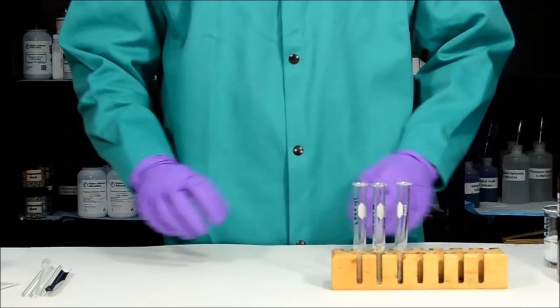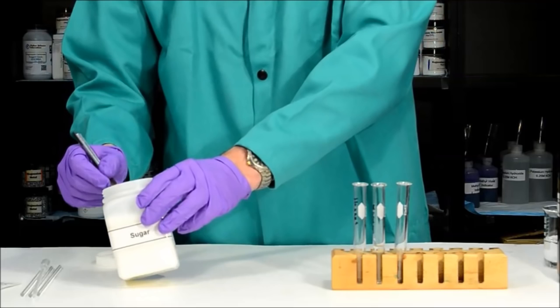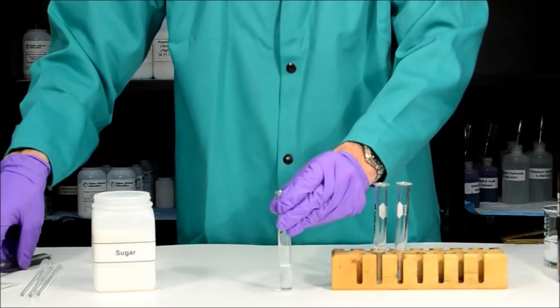Now that the solvents are in the test tubes, it's time to test the solubility of sugar in each solvent. I'll get a small amount of sugar at the end of a spatula and add it to the hexane test tube. I'll insert a stirring rod and gently swirl to see if the sugar will dissolve. As you can see, the sugar is unable to dissolve in hexane — because hexane is non-polar and sugar is polar, they are not alike, so the sugar will not dissolve.